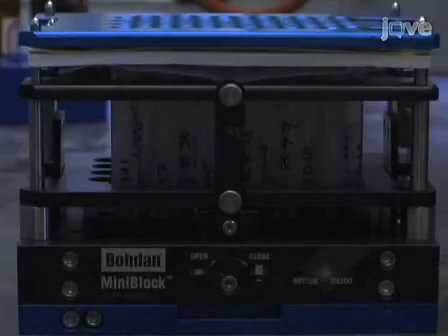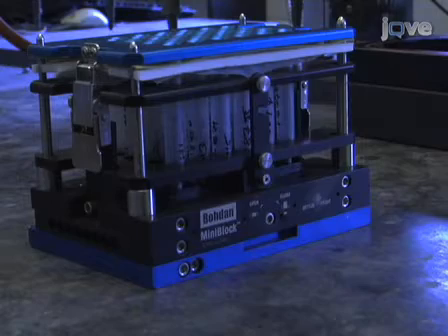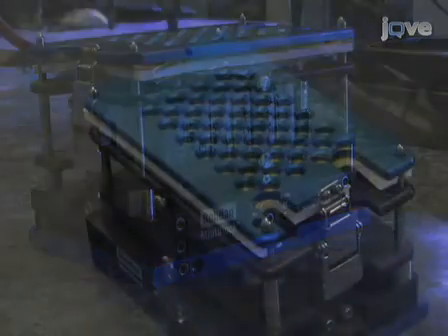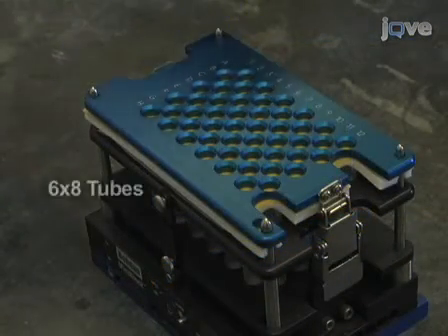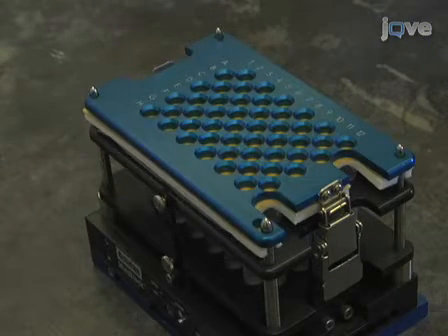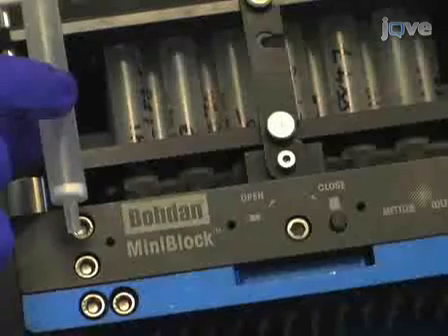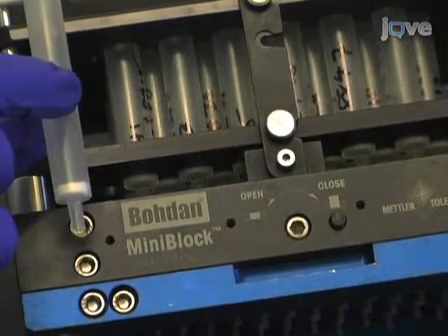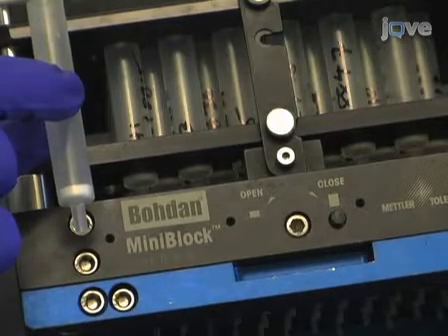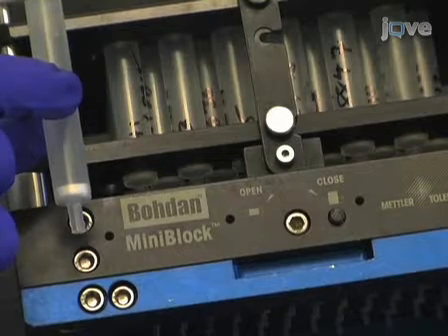The MiniBlock is a tool made by Mettler-Toledo that enables you to perform reactions in parallel. This MiniBlock consists of a 6x8 array of tubes with a filter at the base. These tubes can handle about 3.5 milliliters of solvent. A valve at the bottom of the MiniBlock will be kept closed during the addition of reagents, and then opened later when you are ready for the filtration step.